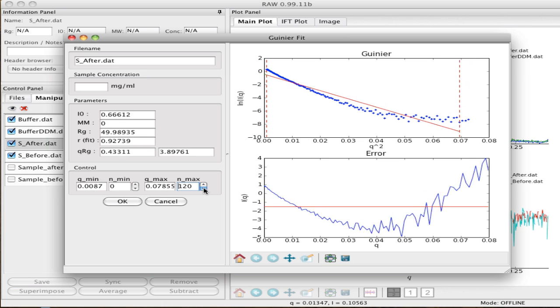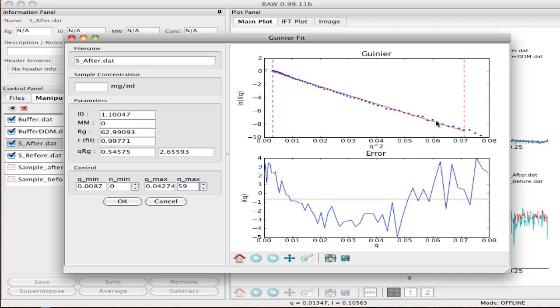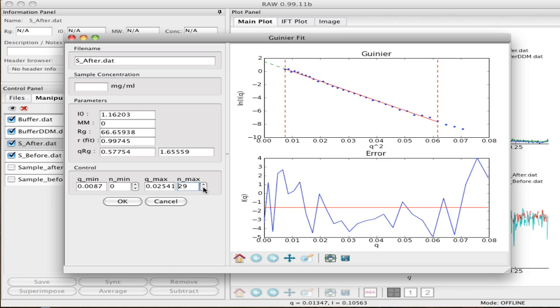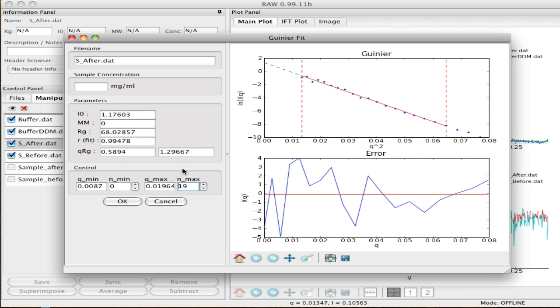This is really what it should look like when there's no aggregation. You notice it's actually flat long before we've reached a qRg of 1.3, which is probably indicative of some kind of disk shape. But let's move it down to where it ought to be. Okay, here we go. At a qRg of 1.3, 1.296 in this case, notice that we still have a fair number of points on the curve. The qRg at the minimum point, right here, is 0.58, which is less than half of 1.3. That's very good. We have enough points to have a valid Guinier plot.